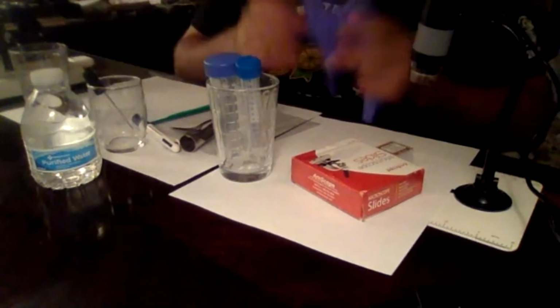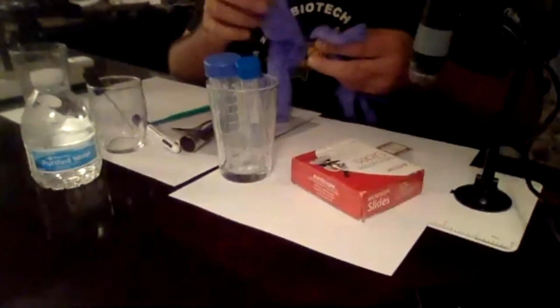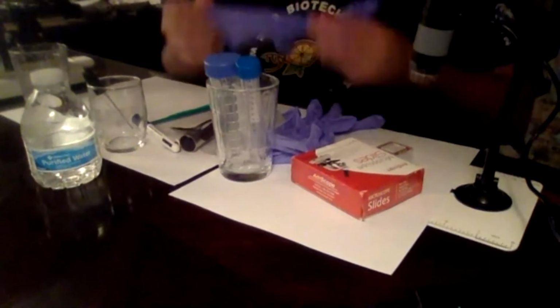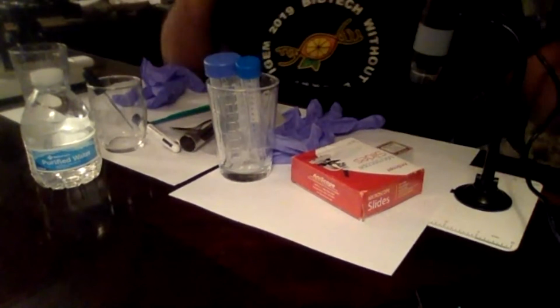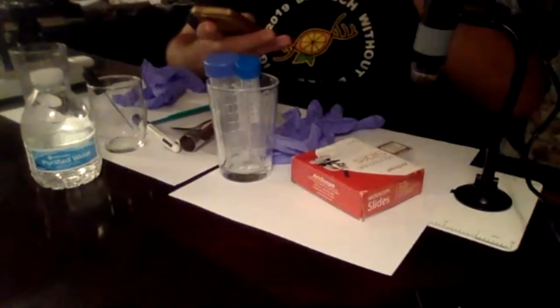When you're working with soil, if it's in your garden, it's going to be pretty fine. Maybe just wash your hands. But if you're doing it from a site that has human disturbance or an urban area, maybe you want to wear some gloves, because it's really important to protect yourself, because you may not know what's going on. For the purpose of the workshop, I'm going to be going into my parents' garden on their balcony, and we're going to look at these microbes overall.